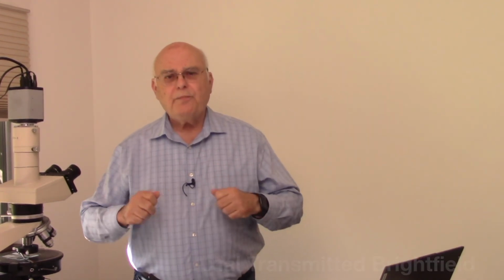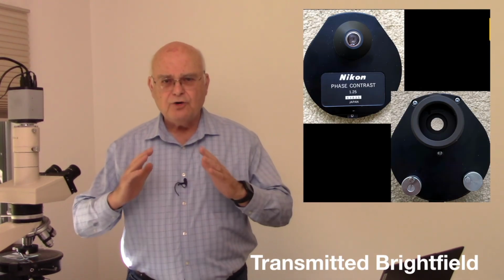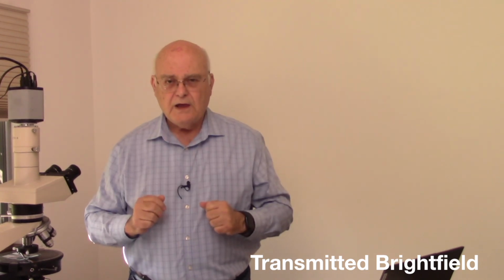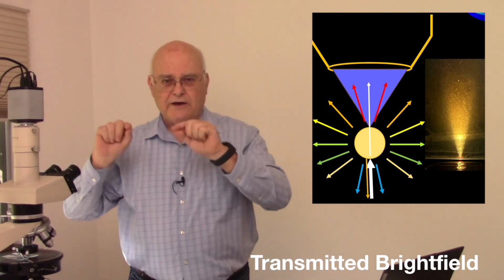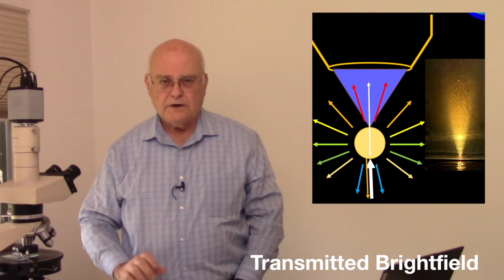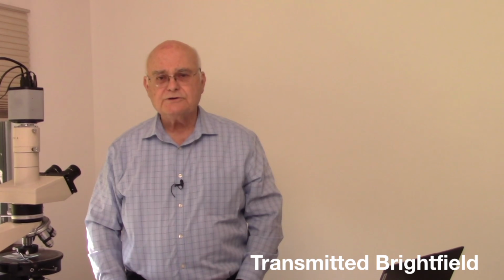If we now open up our substage condenser, now we're getting a cone of light coming into our particle. And you can see that again here on the right side with our frosted tape. You can see you've got a cone of light coming up out of the particle on the stage.